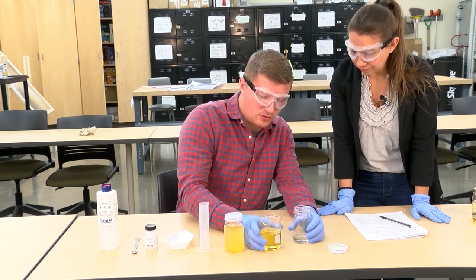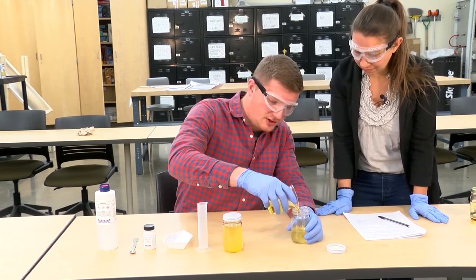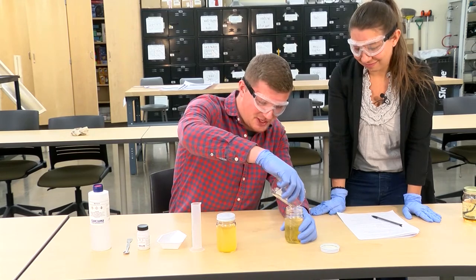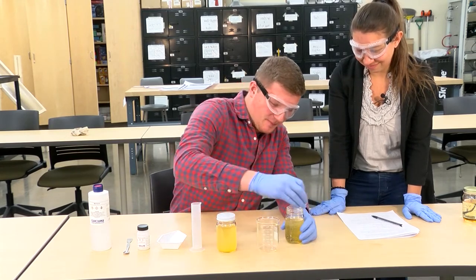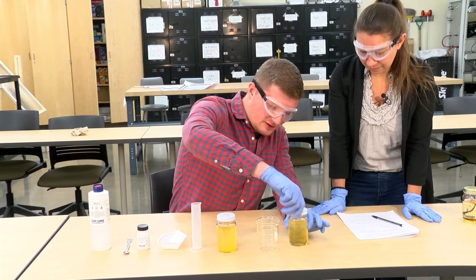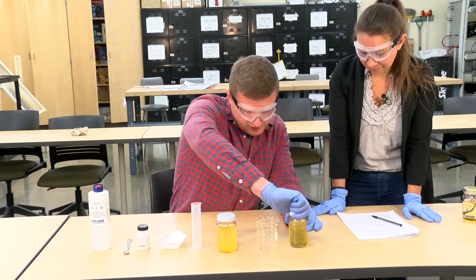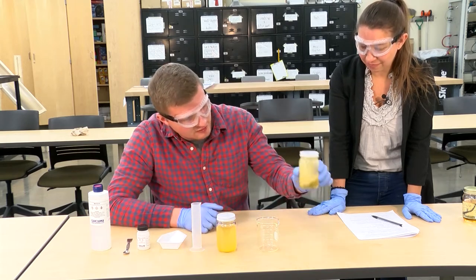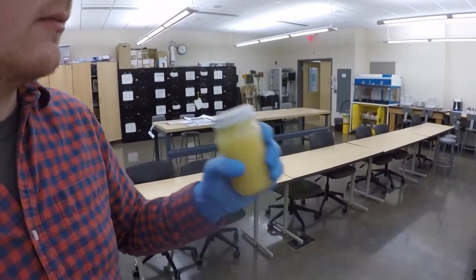Take the oil and pour it in here, and then we have to vigorously shake it for about 10 minutes. It looks a little bubbly and the oil hasn't really mixed yet, but once you shake it, you see that immediate reaction happen.